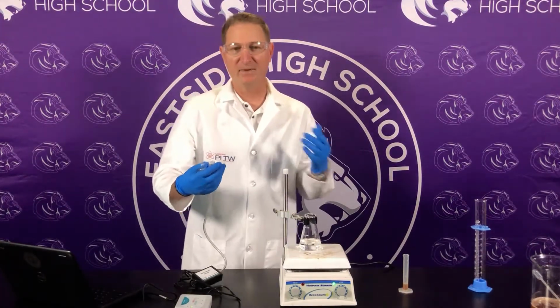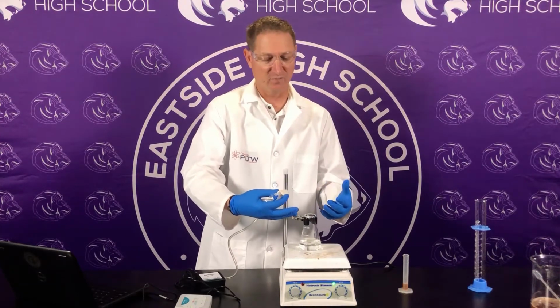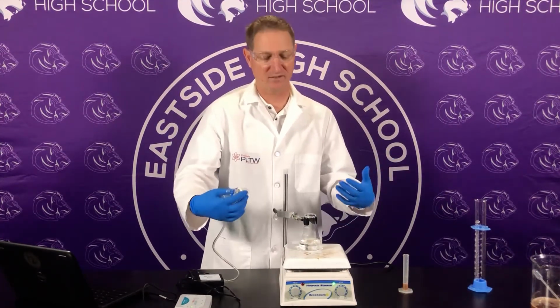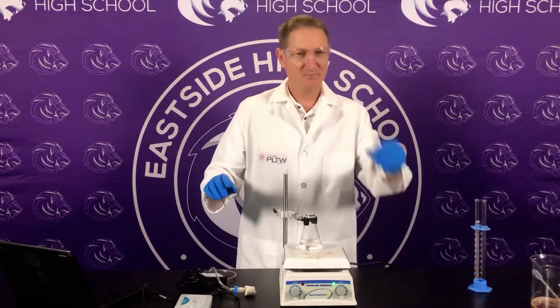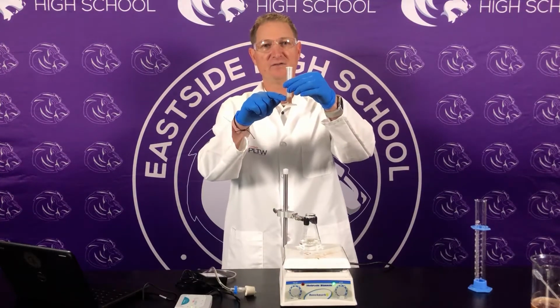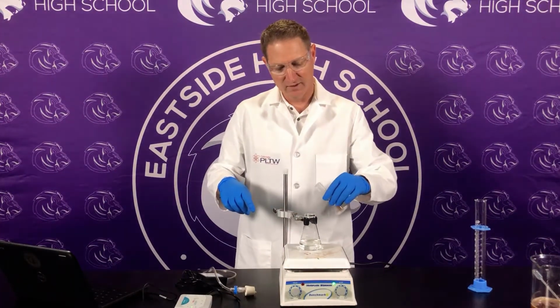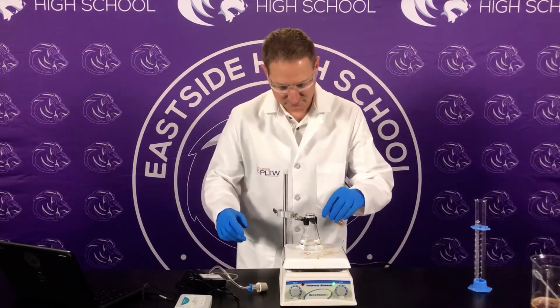Remember, we are measuring the pressure of gas inside for the rate of reaction. If we know how much oxygen is given out, there'll be more pressure, so we can check the rate of reaction. So we're all set up, we're ready to go. I'm going to take my 2 mLs of the catalase that I produced from the potato and water. I'm going to dump it in, secure this, and press start.